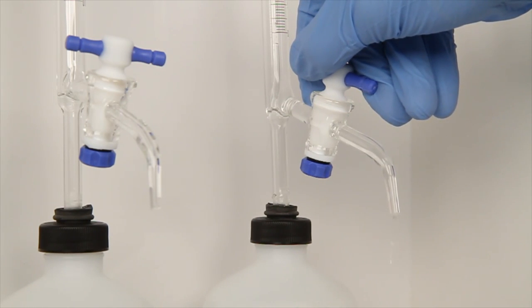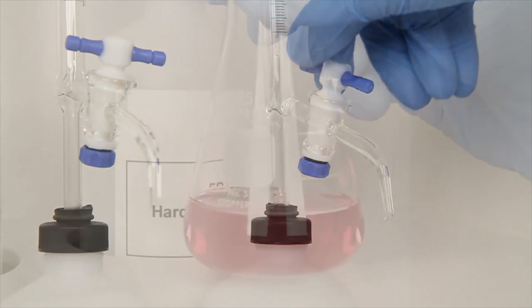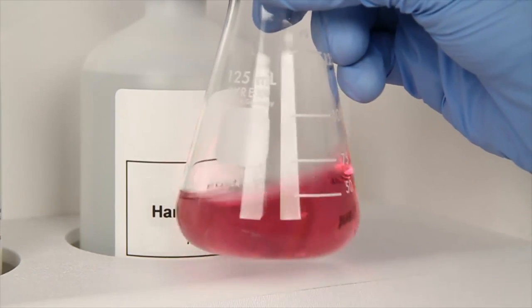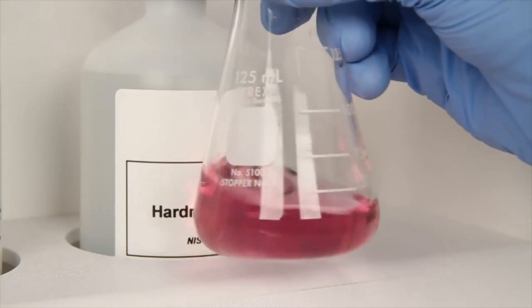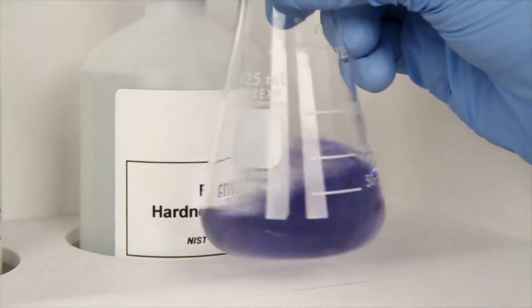As you near the end point, turn the stopcock so the titrant is being dispensed slowly. Make sure you continue mixing the sample after each drop until the sample color changes from red to blue.